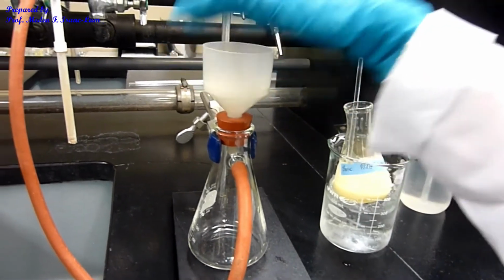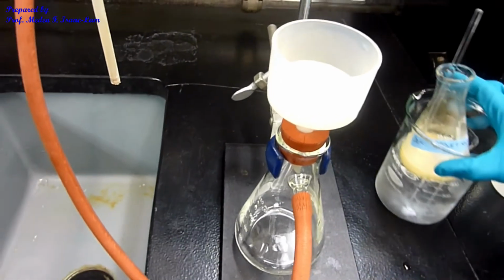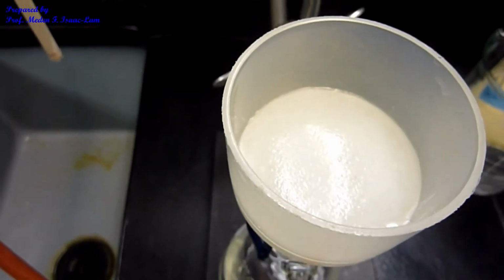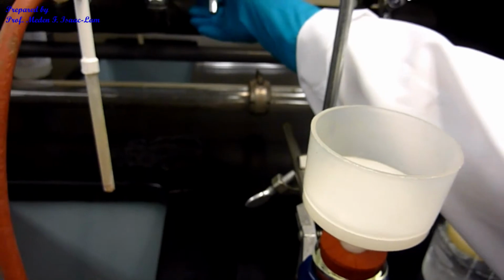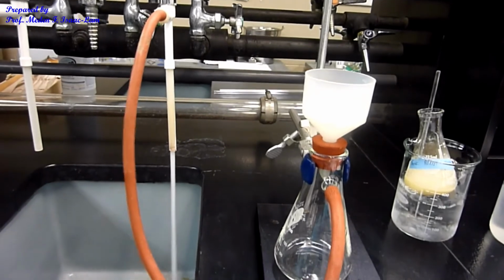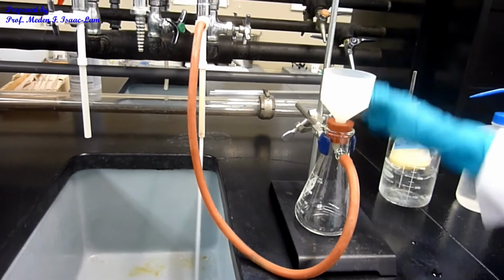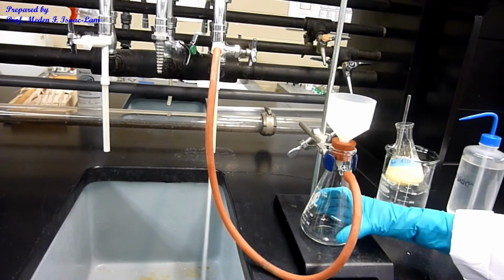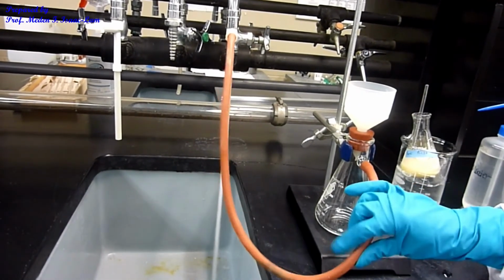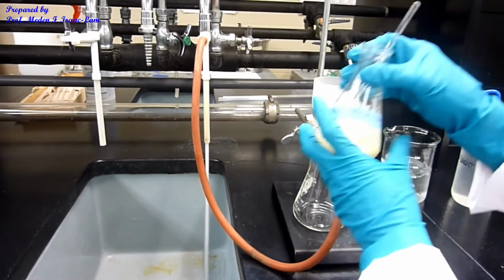So right now I have the filter paper inside, and I will now filter my sample. I will have the water on. So the water aspirator, again, we do a filtration. The water aspirator is connected to my filter flask. So you clamp the filter flask into a stand so it does not fall all over you. And then I have it connected with a thick-walled rubber tubing to the water aspirator, and now I'm ready to filter. So I'm just going to filter this.